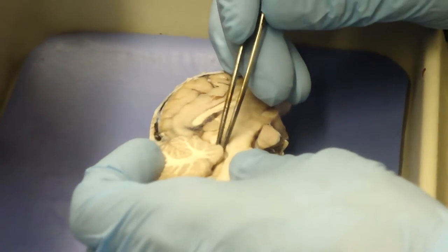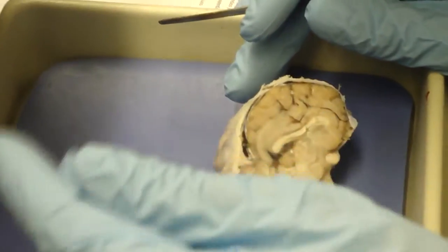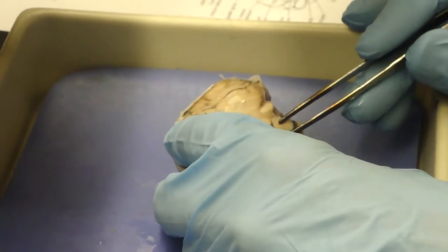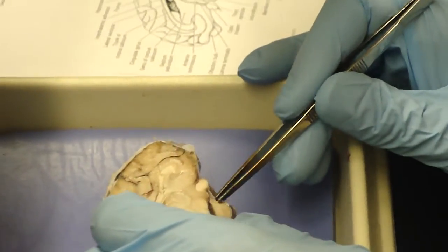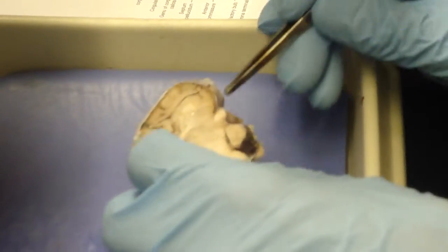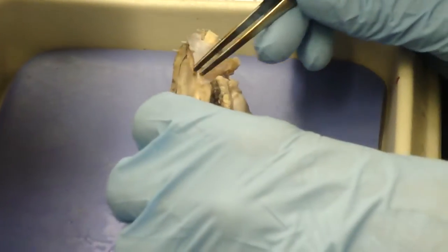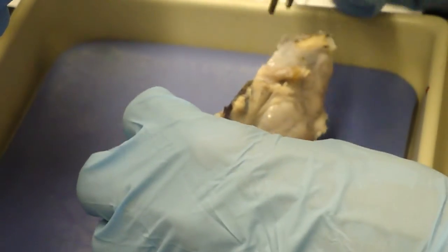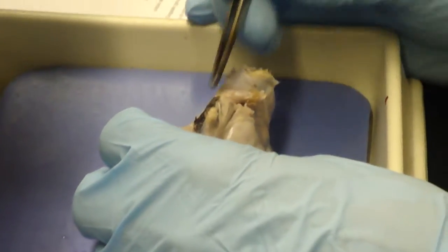The roof of a ventricle, I can just see a little bit right here. Tela choroidea is the name for this tissue that roofs ventricles, and its cells are important in secreting cerebrospinal fluid. This down here would be the pituitary under the brain. I'm not sure I see a connection from the hypothalamus into that, maybe the other half of the brain had that. This big white thing here, with a piece coming this way and a piece coming from the other side, is the optic nerve, and where the two sides cross over each other is the optic chiasma, the letter chi being across, so very simple, an X shape.